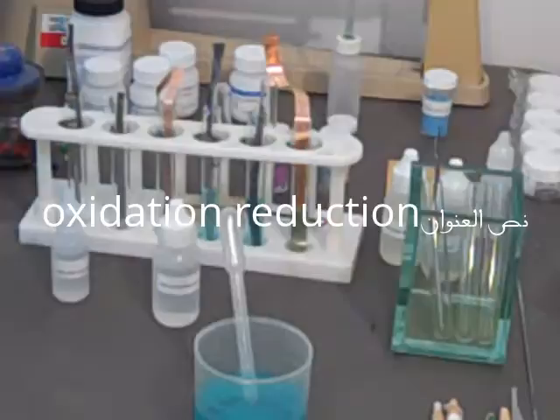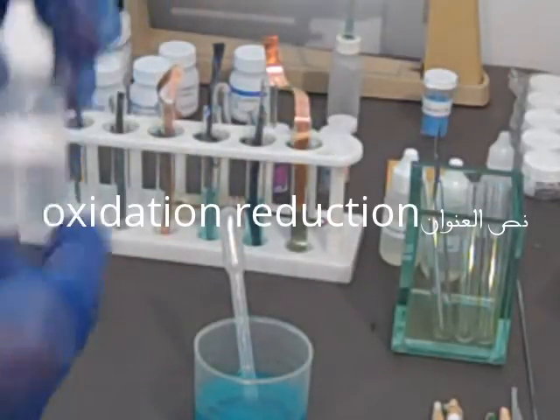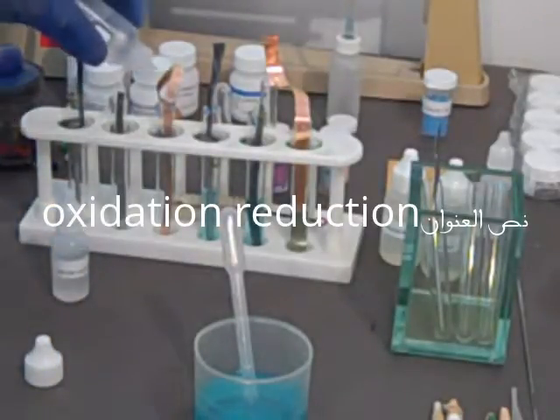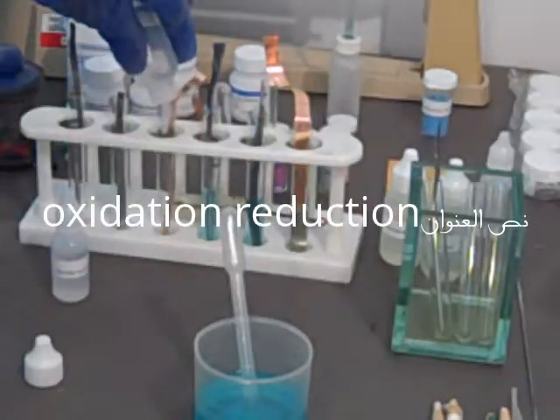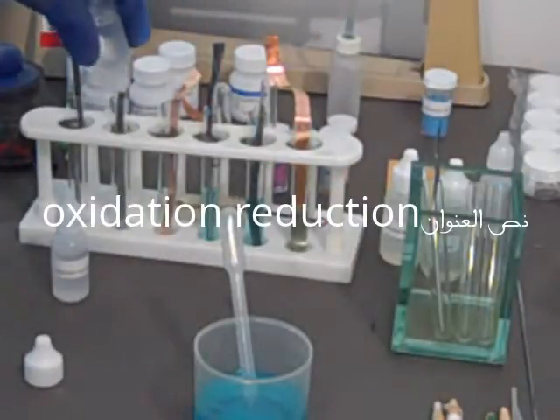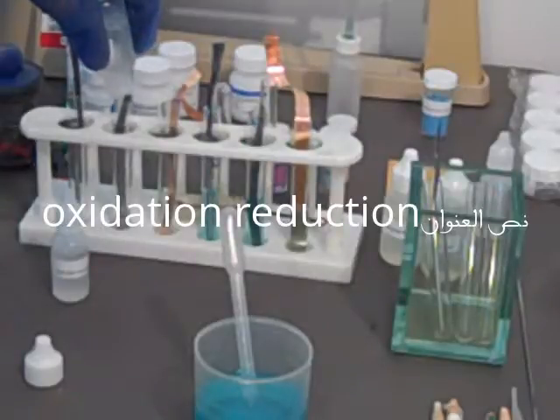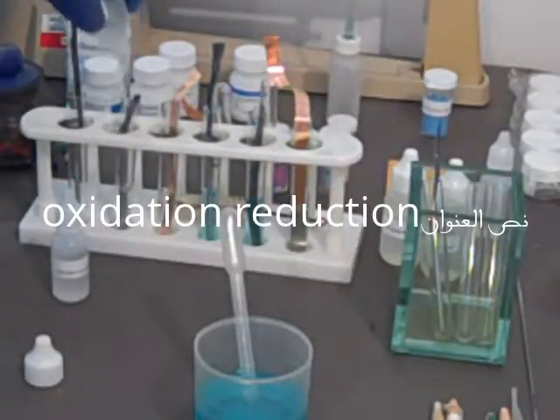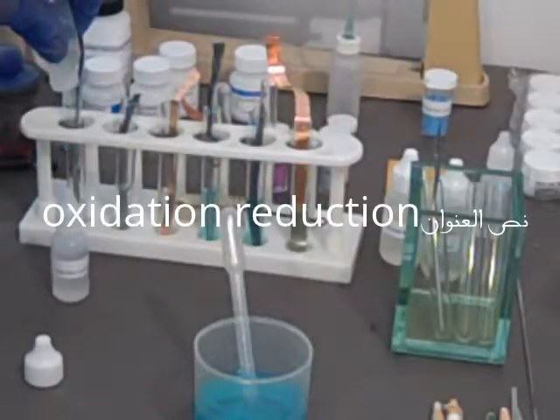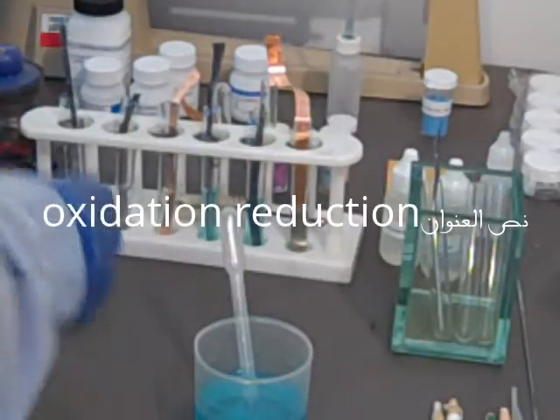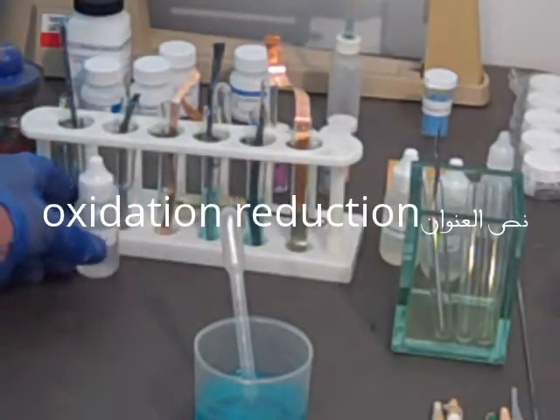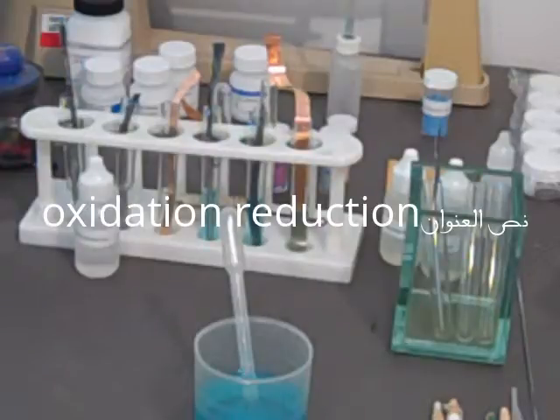Where the copper sulfate is, put some more in there. And a few drops more in here. You see something on the lead. Alright, let's put the lead into our second set and make sure we have the shiny side out here. The copper. And this will be the lead nitrate, lead nitrate solution.